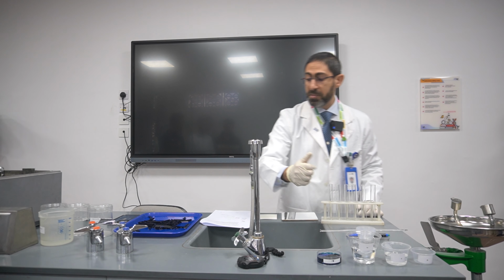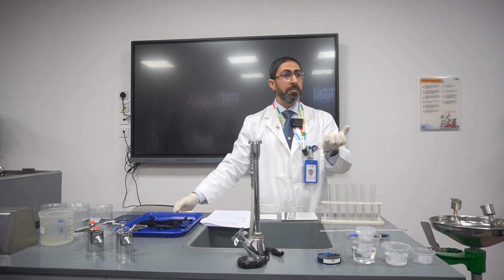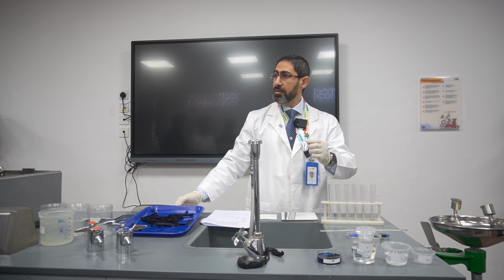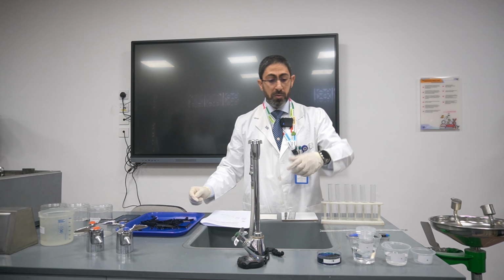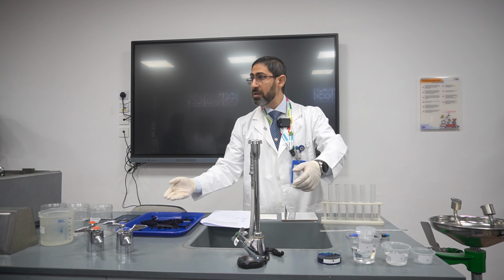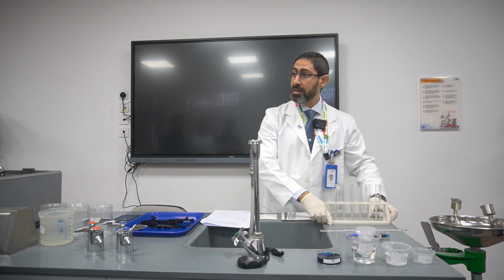The potato was soaked in methylene blue, which is a dye that is taken up by the plant cells. Actually, before you came to the lab, we rinsed off the excess methylene blue in order to have a proper way of handling the experiment.